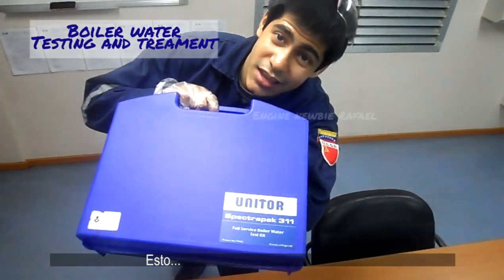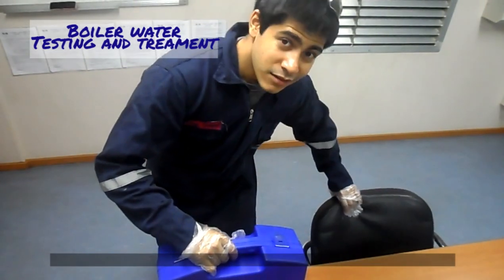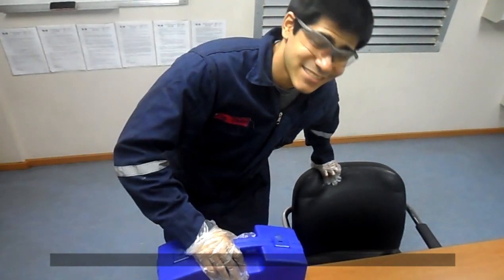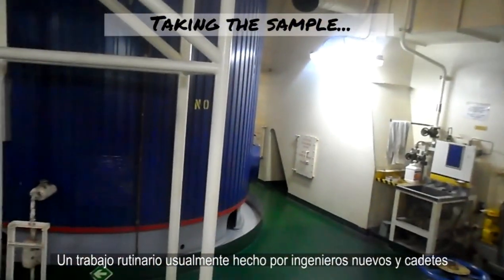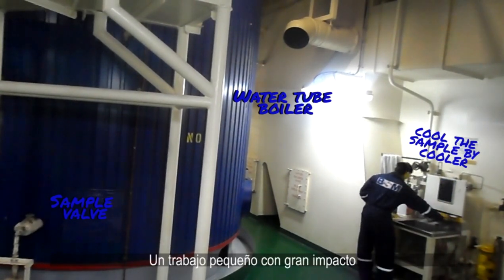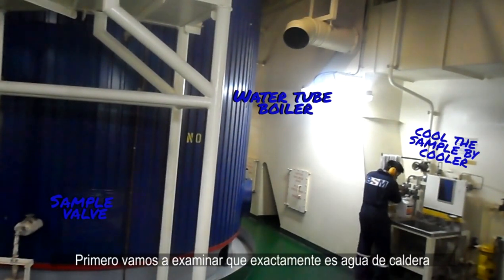This is boiler water testing — have a seat, this is going to take a while. Boiler water testing is a routine job usually done by junior engineers and cadets. It's a small job with a big impact.